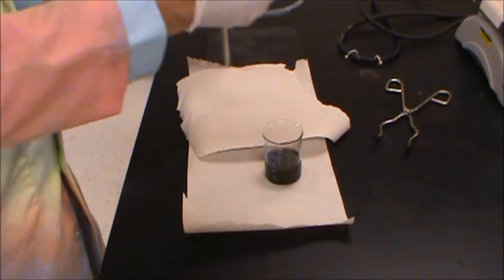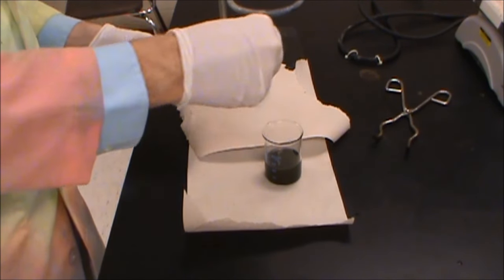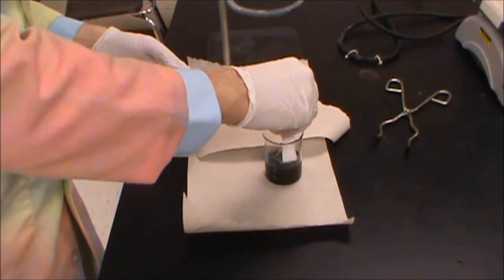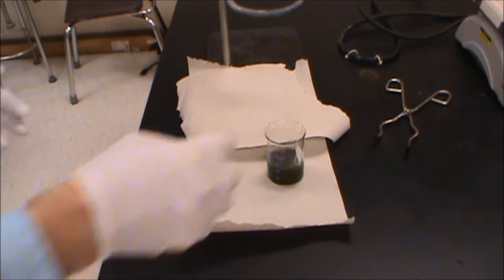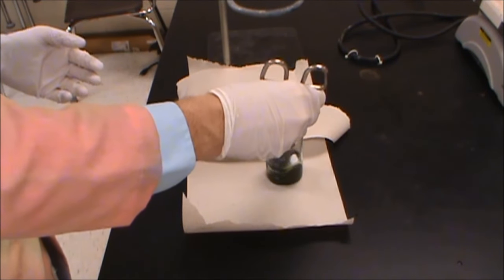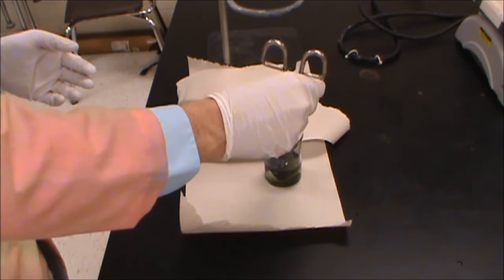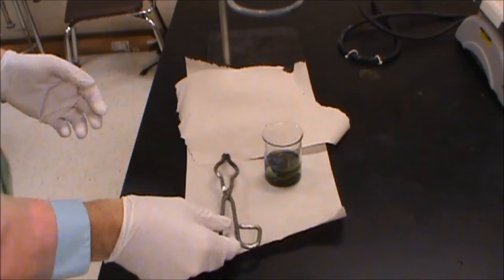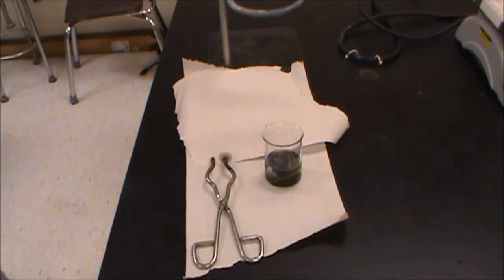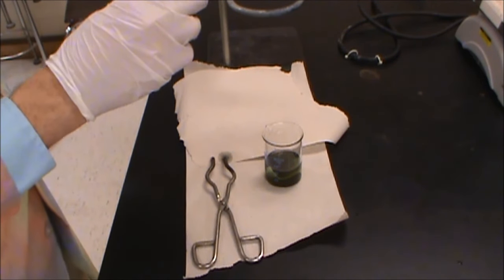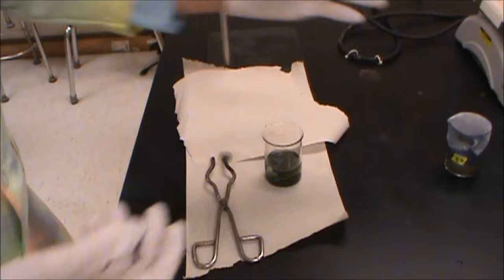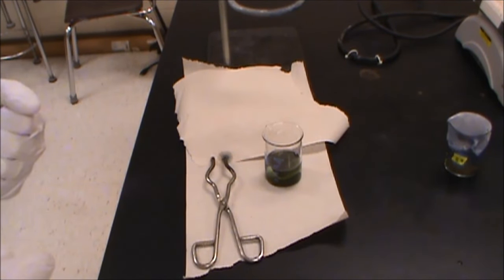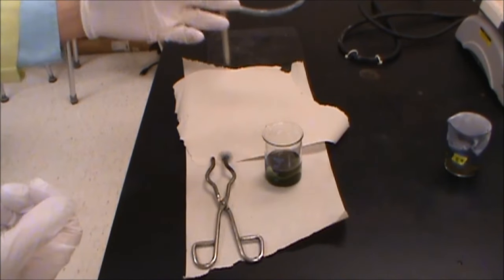And then what we can do is we can just take our fabric and we can set it inside of there. We're going to let it soak for, I don't know, 5 minutes or so. We'll go ahead and do it just like that and we'll go ahead and use some tongs for the rest. Now what's important with this is you definitely want to get it well beneath the surface and you also don't want to stain anything else. You want everything to go on top of there. The reason why you want to keep it away from the surface, here's an old batch that we had before. So you can see there's a layer of blue here at the top and that's where the indigo is reforming as the oxygen re-oxidizes it back to the regular form. This is a different reduced form and so that's why we're seeing a different color. What we're going to do is we're going to let that soak, then we're going to take that out and we're going to let it sit on here and it's going to reform into the blue.